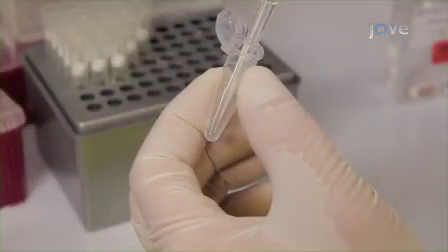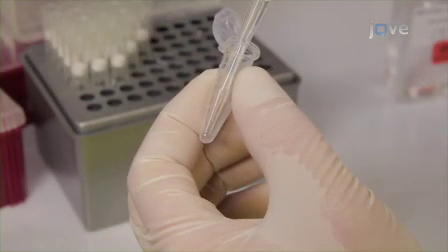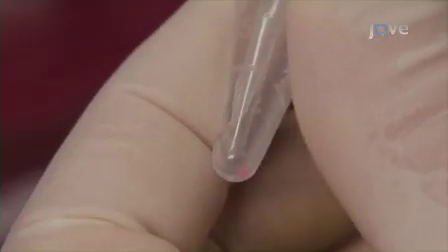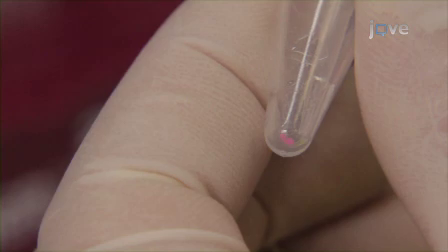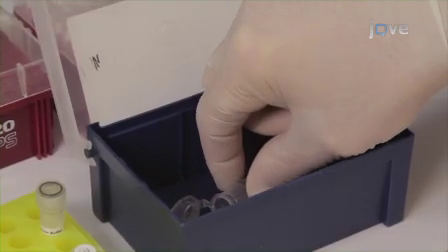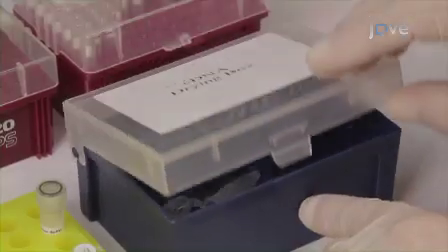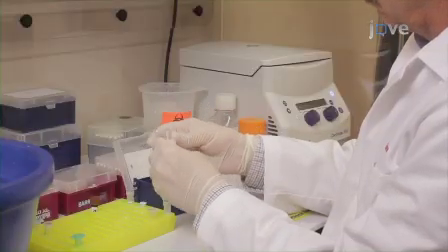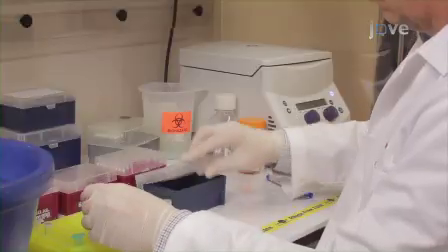After removing all of the ethanol possible by using a P1000 micropipette, centrifuge the tube at full speed for 5 seconds. Then use a P10 micropipette to remove the last few microliters of ethanol without disturbing the pellet. Place the open tube in a drying box for 10 to 20 minutes to evaporate the remaining ethanol. The pellet is easily lost once it is dry, so be careful to handle the tube gently and to close the cap when drying is done.